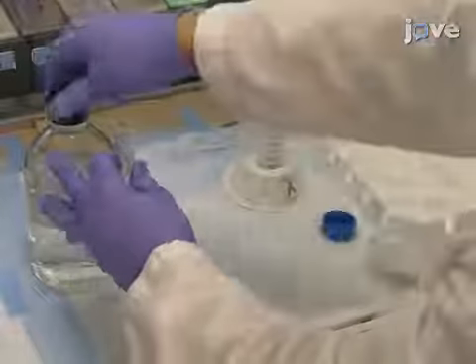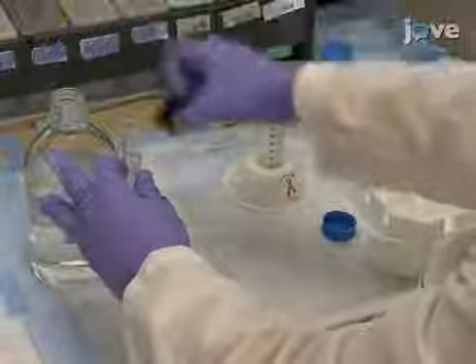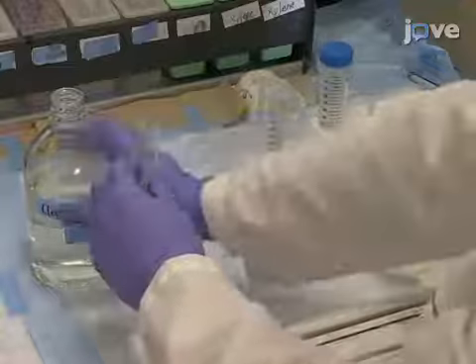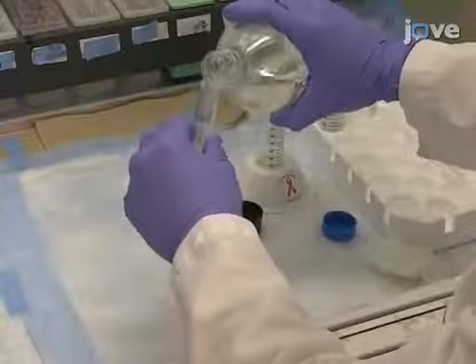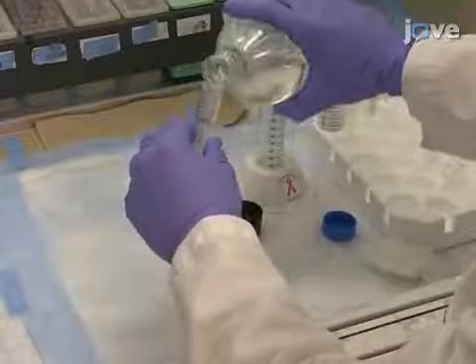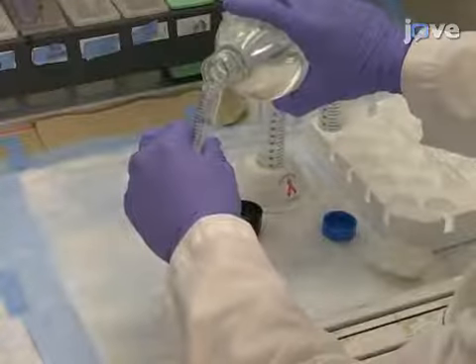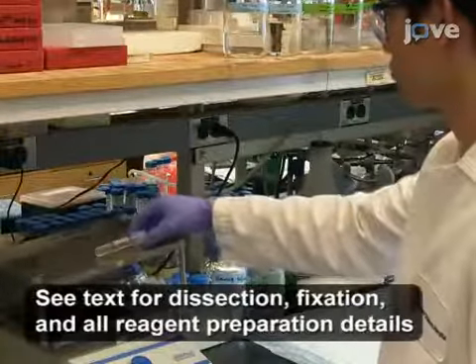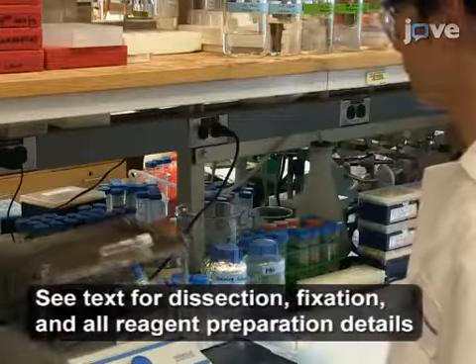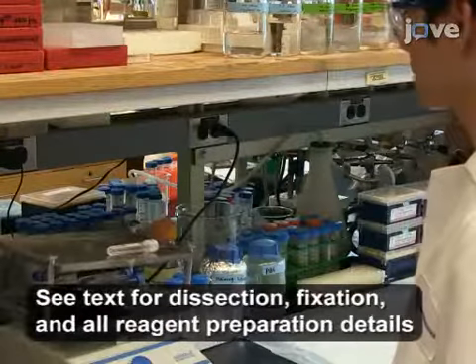After dissection and fixation of the embryo as described in the text protocol, replace the fixative with clearing solution and gently rotate the specimen on a rocker at room temperature for one to two weeks.